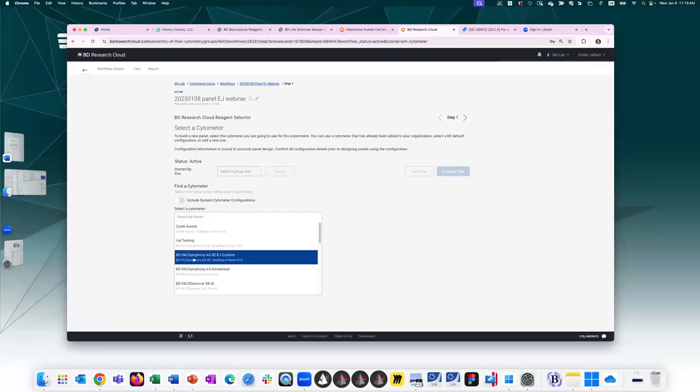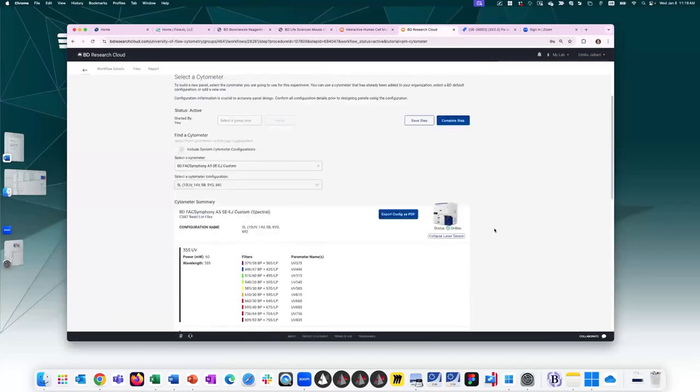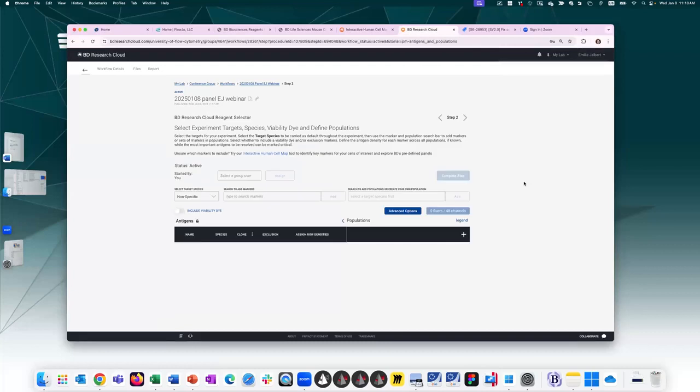So I'm going to go ahead and select the A5SE for today's demonstration. If I want to double check the configuration of the cytometer to make sure, yes, this is the one that I intend to build the panel for, then I can go ahead and press complete step. So now we're on to step 2, adding the markers that are of interest for my panel. First step, select target species.